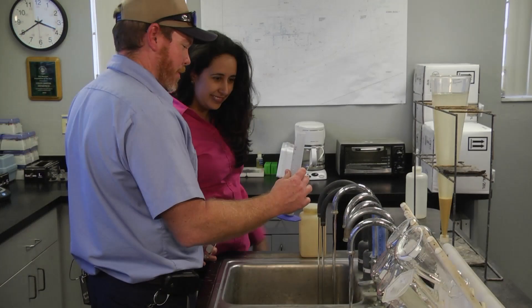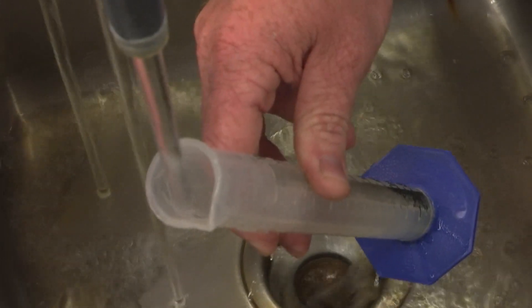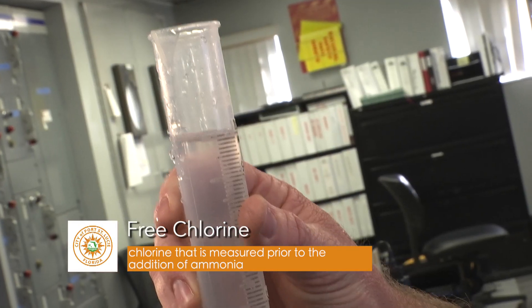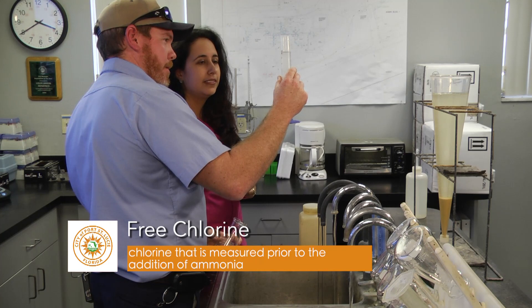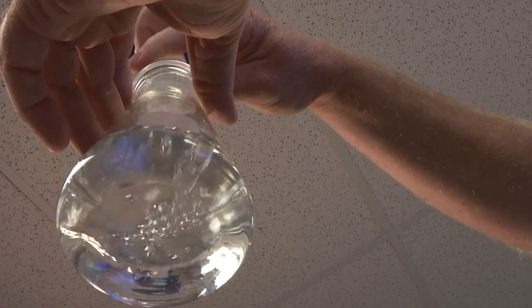Alright, we're going to grab a 100 mil sample of our transfer to check for our free chlorine. And you want the bottom of the bubble to be right at that 100 mil line — that's the meniscus. It's going to be right there. And then you dump it into your flask to check your chlorine.